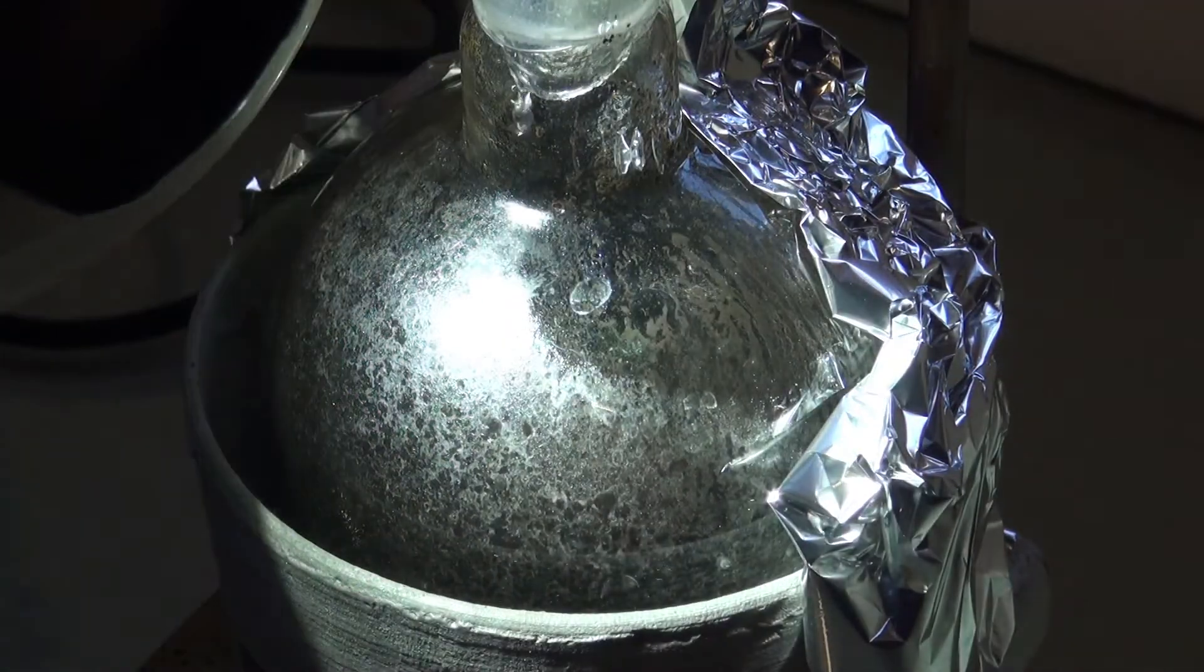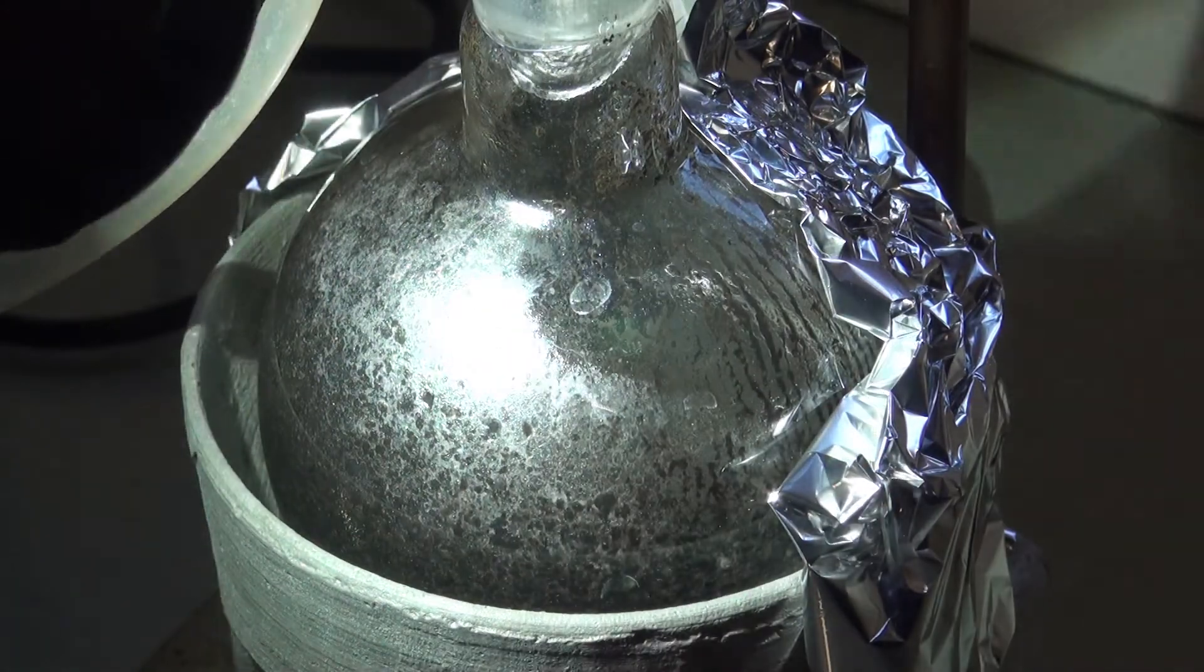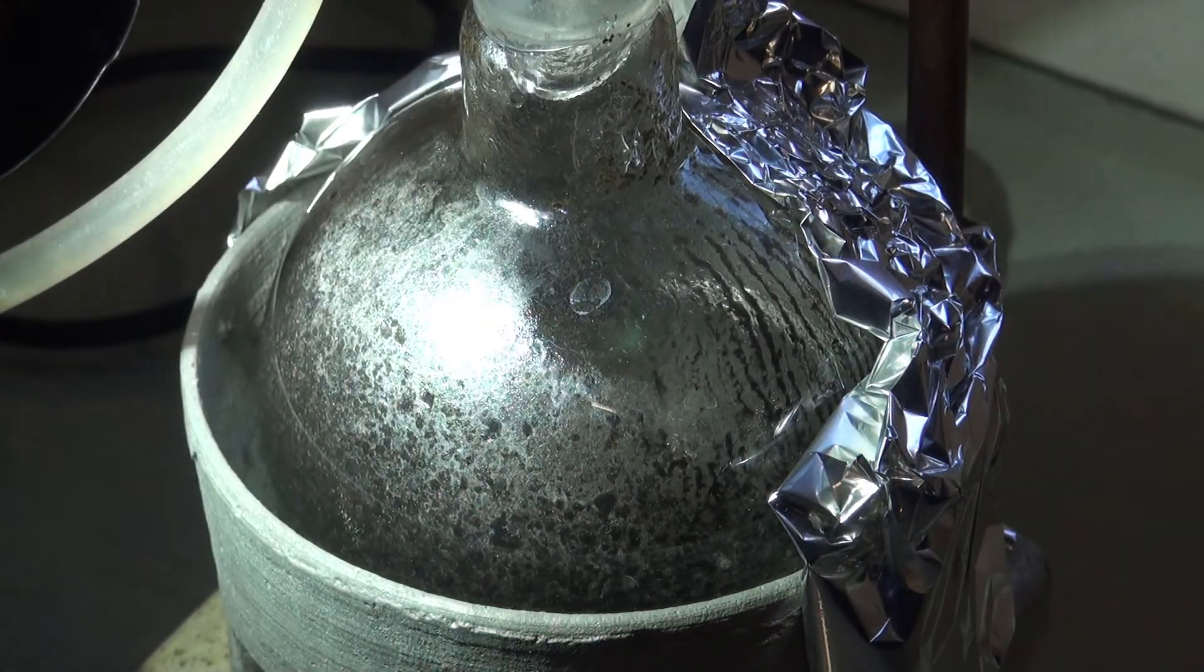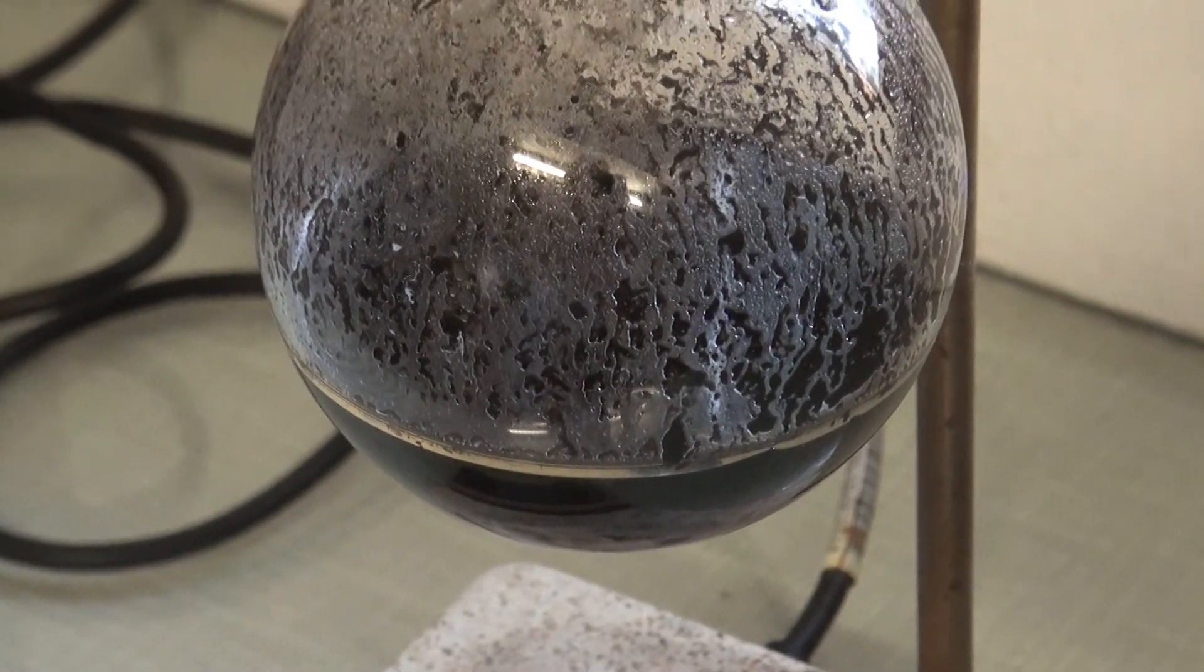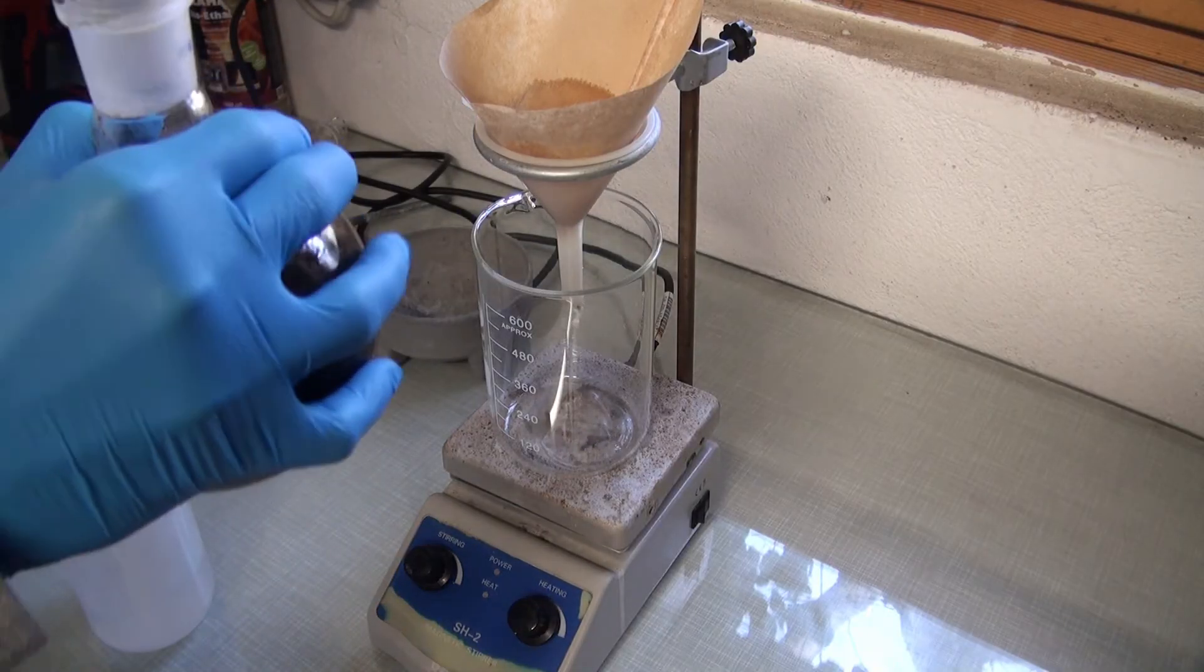When the reaction was finished, a brown-black precipitate was observed. This is manganese dioxide. It was filtered off and washed with water.